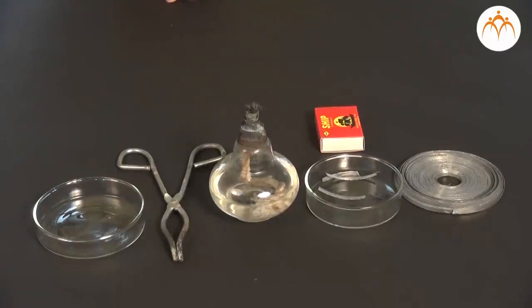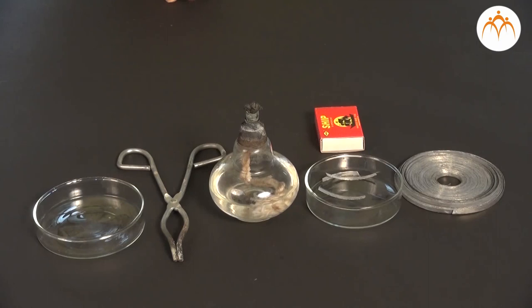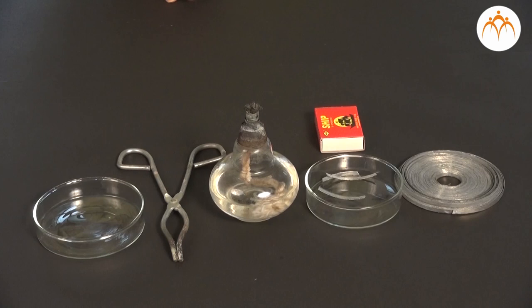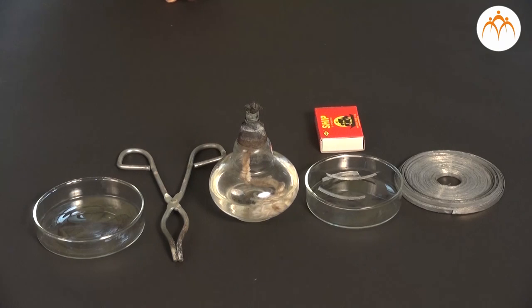In the first chemical reaction, we are going to take magnesium and burn it in air. We take a small piece of magnesium metal. We need a pair of tongs, beaker, sandpaper, watch glass or china dish, glass rod, test tubes, and test tube holder. We keep all this apparatus ready.